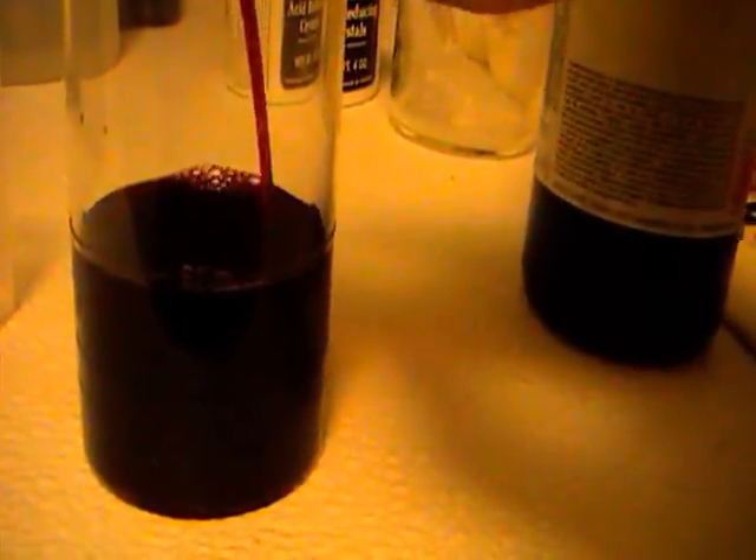So doing your test is quite easy. I already have a wine sample here. So we take our little beaker here, and we are going to fill it to the 50 milliliter mark. Remember I'm holding a camera while I do this, and I'm not a very good ballet dancer so bear with me here. Okay, we got that — so we added that to the 50 milliliter mark.